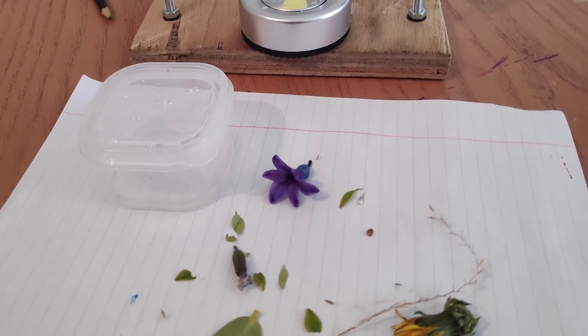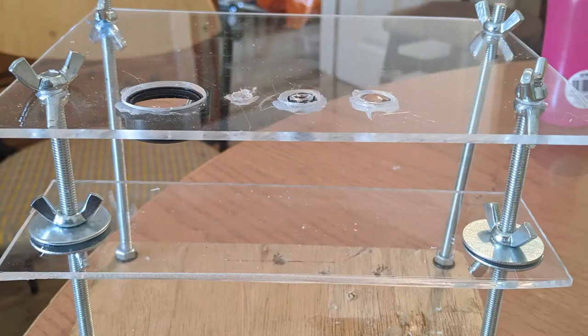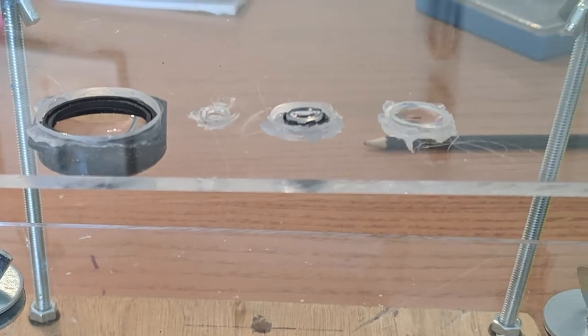We had lots of fun making our microscope. Now you can go off and make a microscope and have enormous fun learning about the tiny worlds that surround us. That was great — we saw right into the little world. These are fascinating little projects for children, really good in these days of COVID lockdown, teaching my daughter lots about science. And it cost virtually nothing — about ten quid for all the materials.